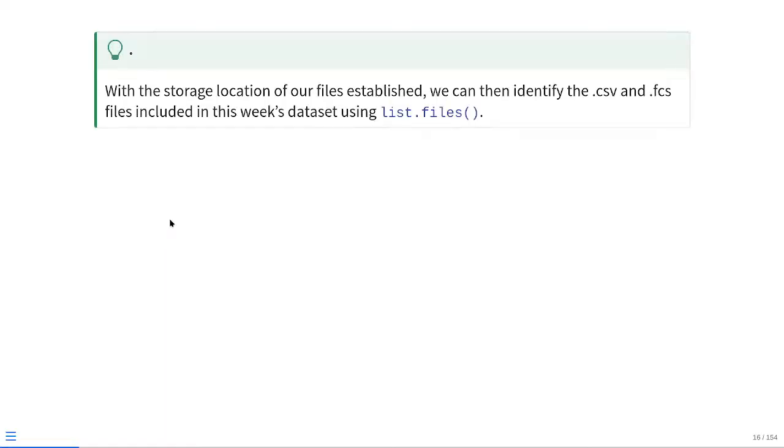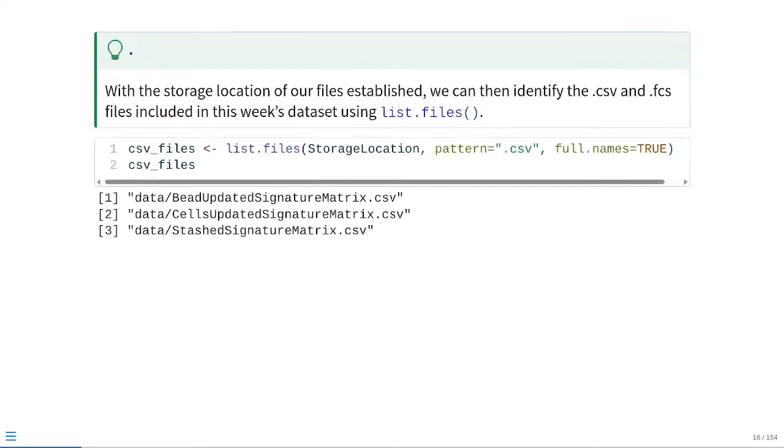With the storage location of our files now established, we can identify the CSV and the .fcs files located within using the list.files function. As we've seen previously, we pass it our storage location file path. We're identifying the CSV files at this point, so for pattern we're providing .csv. Because we want the full file path between our working directory and those individual files, we set the full.names argument equal to TRUE. As you can see, we end up with three different CSV files, one for the bead signature matrix, one for cells, and the stash one also contains some of the unstained. We'll work with these individually in just a little bit.